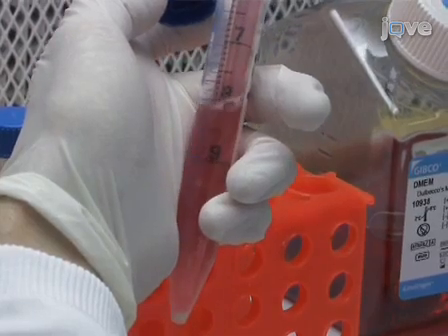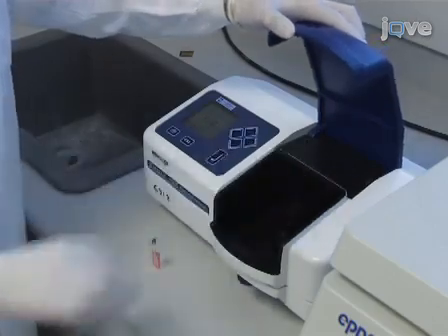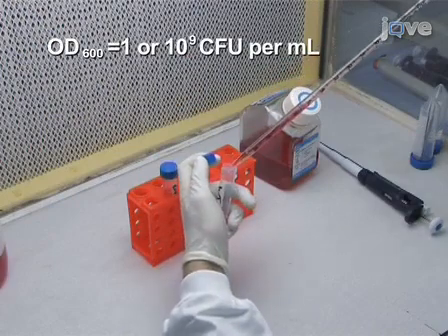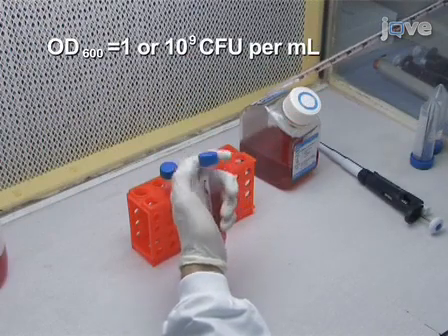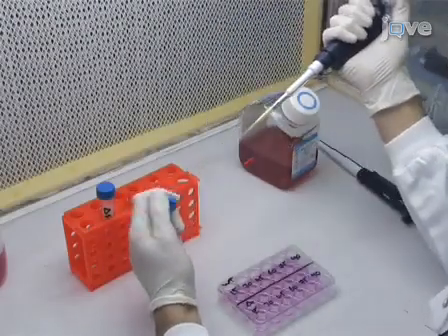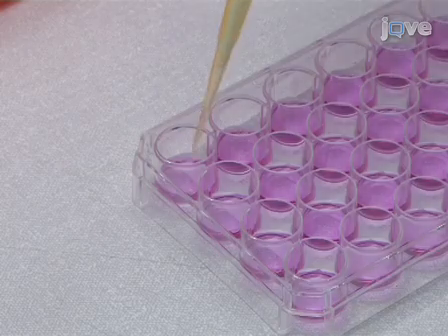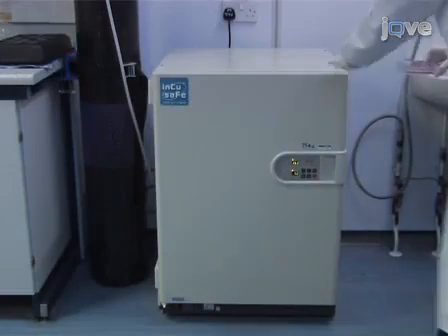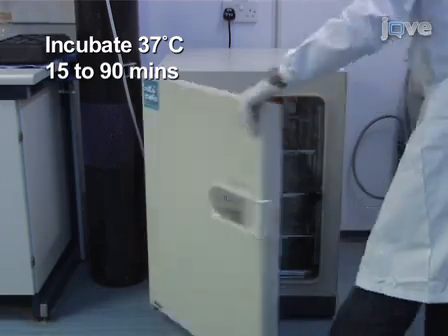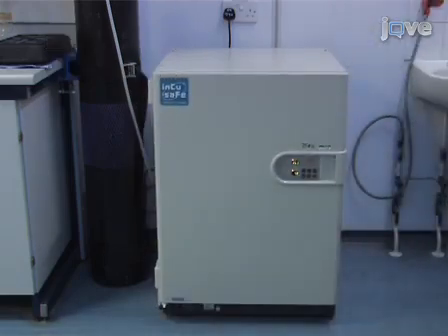Resuspend the bacteria in DMEM and measure the optical density of the suspension. Adjust the concentration to obtain an OD 600 of 1.0, which corresponds to approximately 10 to the 9 colony-forming units per milliliter. Once the bacterial suspension is ready, add 10 microliters of bacteria to each well of the 24-well plate containing the cover slips. Incubate the plate at 37 degrees Celsius for 15 to 90 minutes to allow the bacteria to attach to and invade the cells.